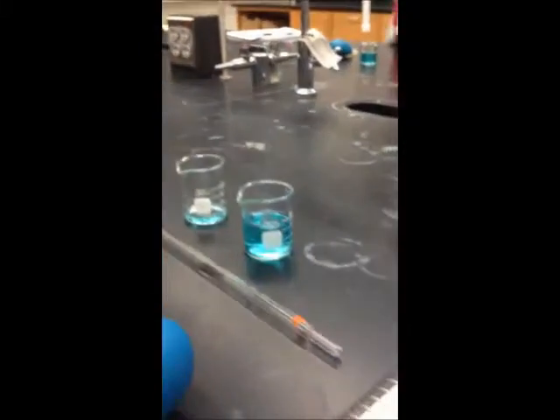Now you can do the calculations. Remember, the volume is equivalent to final volume minus the initial volume. After typing this into the calculator, we see that the volume of the solution is 1.2 milliliters.